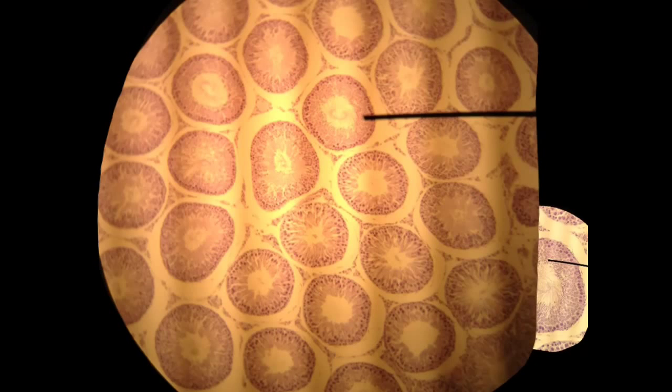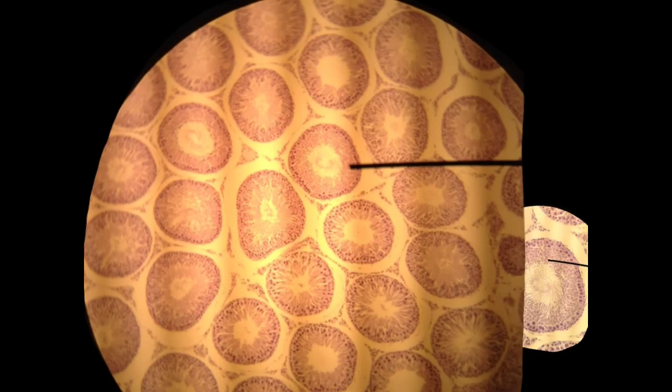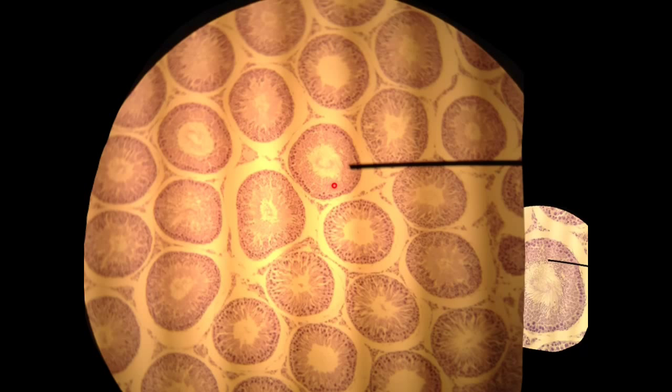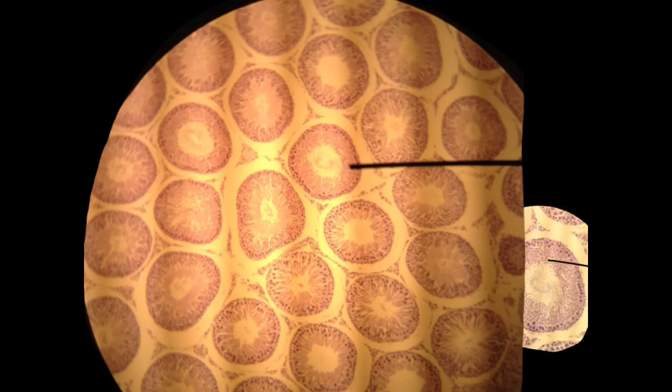Looking at the seminiferous tubules from afar, you can see this one that the pointer's on. It has a darker layer of cells around the outside versus the inside, where the cells look a little bit lighter. The reason they're lighter is because those cells have fewer chromosomes — they are actually haploid cells, so they allow more light to pass through. The dark ones on the outside are still diploid with twice as many chromosomes, all condensed, and they block a lot of light. So we see a dark area on the outside and a lighter area towards the lumen.